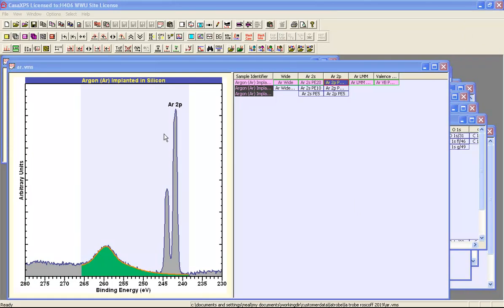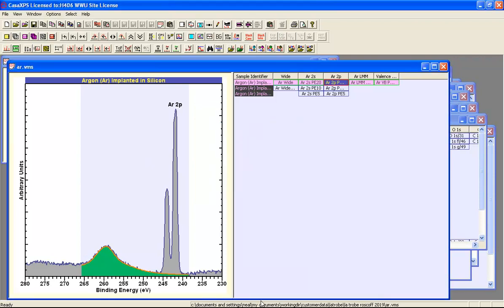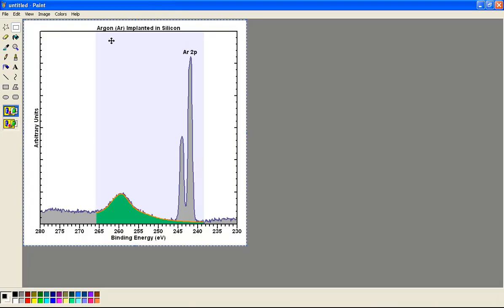In this video, we're going to look at how to get publication quality images passed through the clipboard as a bitmap. In the first instance, let's look at what the problem is with these bitmaps as they stand. If we simply use the display resolution in the left-hand pane and place a bitmap of that resolution and size on the clipboard that's indicated here on this dialog window, and then paste into another program such as Paint, you can see that the image and all its characteristics within Paint are the same as we saw in CasaXPS.